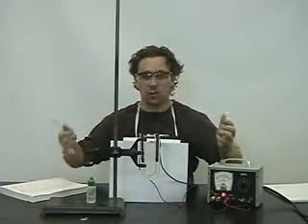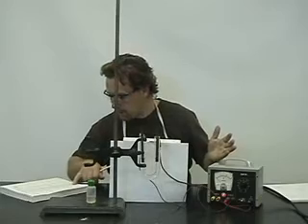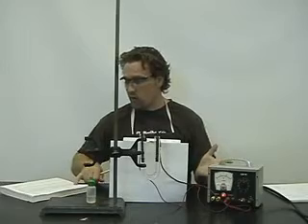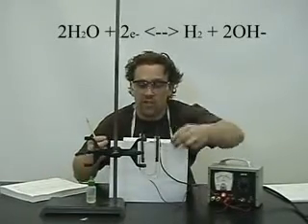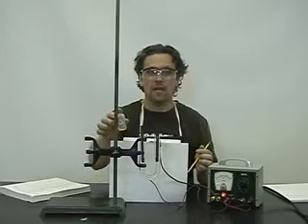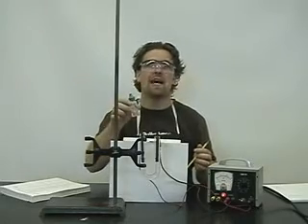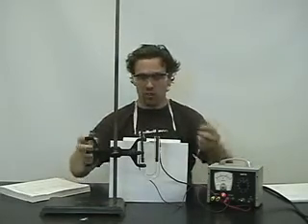If we look at the reduction reaction, we find the highest on the left. We notice that potassium is way towards the bottom — it's not the highest, so it's not going to be reduced. What is going to be reduced is water. Water is going to be reduced into hydrogen gas, so we should also see a little bit of bubbles forming, and it forms the hydroxide ion. To test for that, we're going to add a couple of drops of phenolphthalein, because phenolphthalein in the presence of a base turns pink.